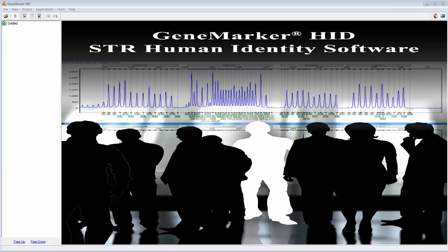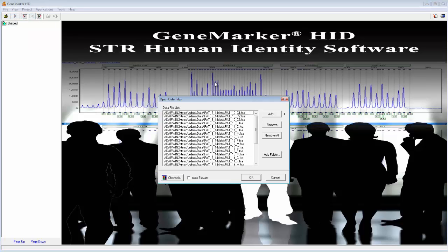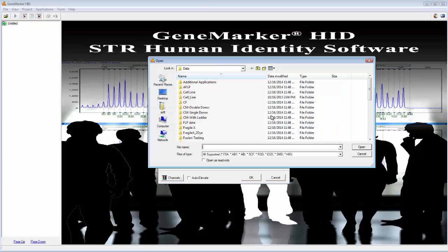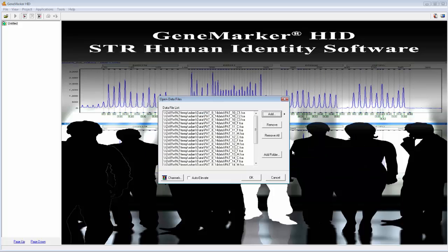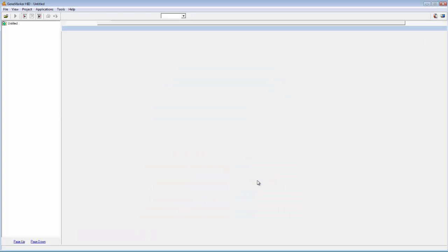So now let's just jump right in and look at some examples of how we can use the Contamination Check tool. To get started here, I'm just going to open some data, and to do that I'm just going to go to File, Open Data. I'm going to click Add and navigate to some sample files here. And then I'm just going to select those files and click Open and OK.